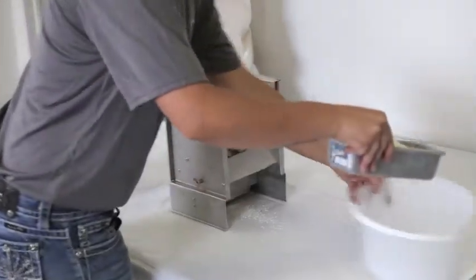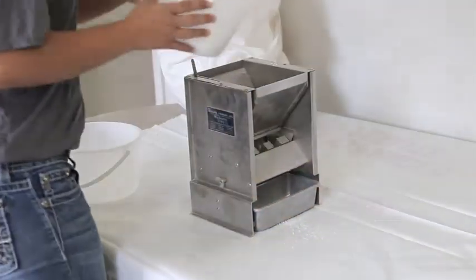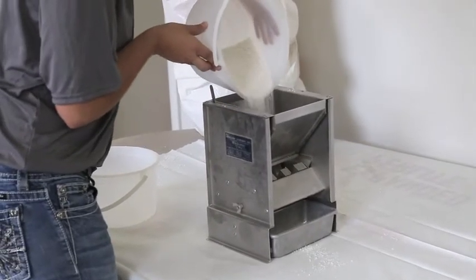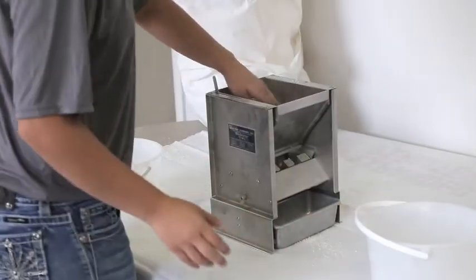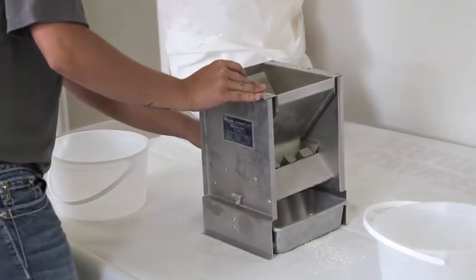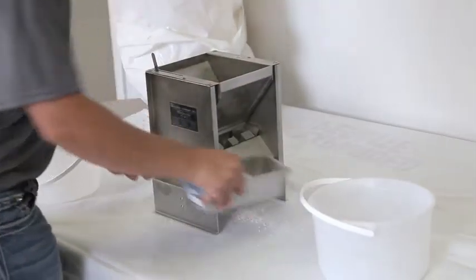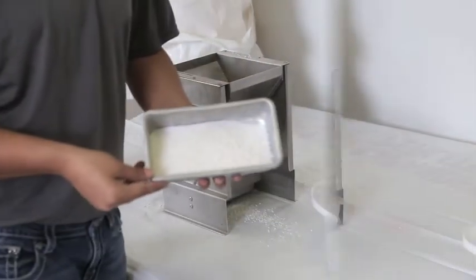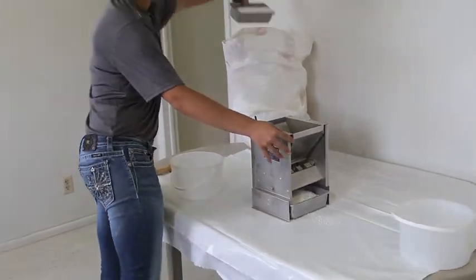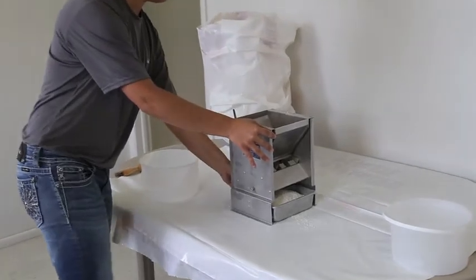Reintroduce the portion of the sample in one of the receptacles into the splitter as many times as necessary to reduce the sample to the size specified for the intended test. During the process, reserve the portion of material collected in the other receptacle for reduction in size for other tests when required.